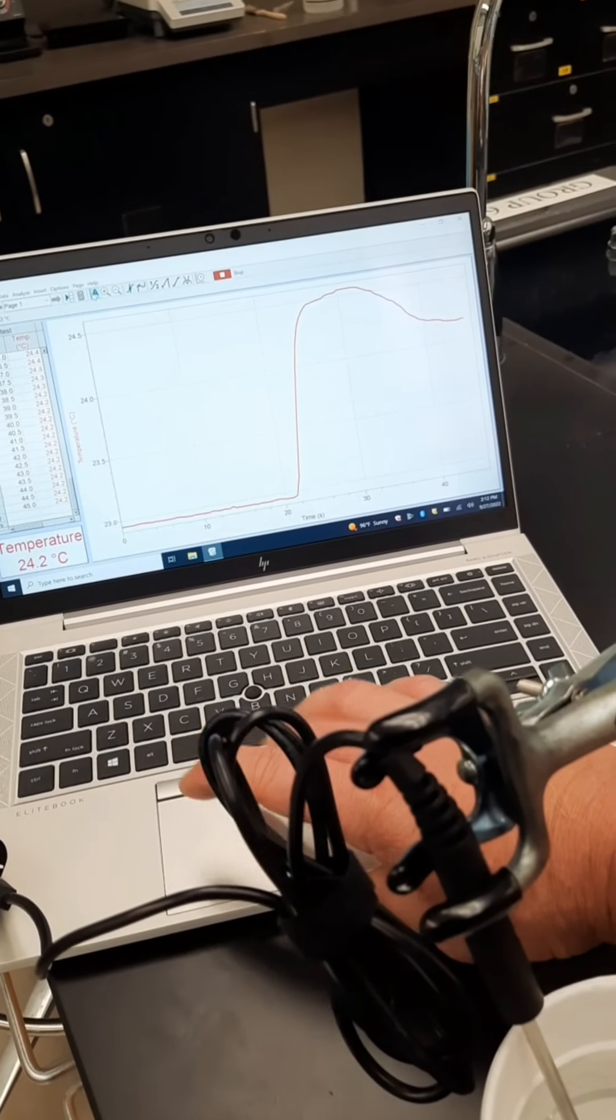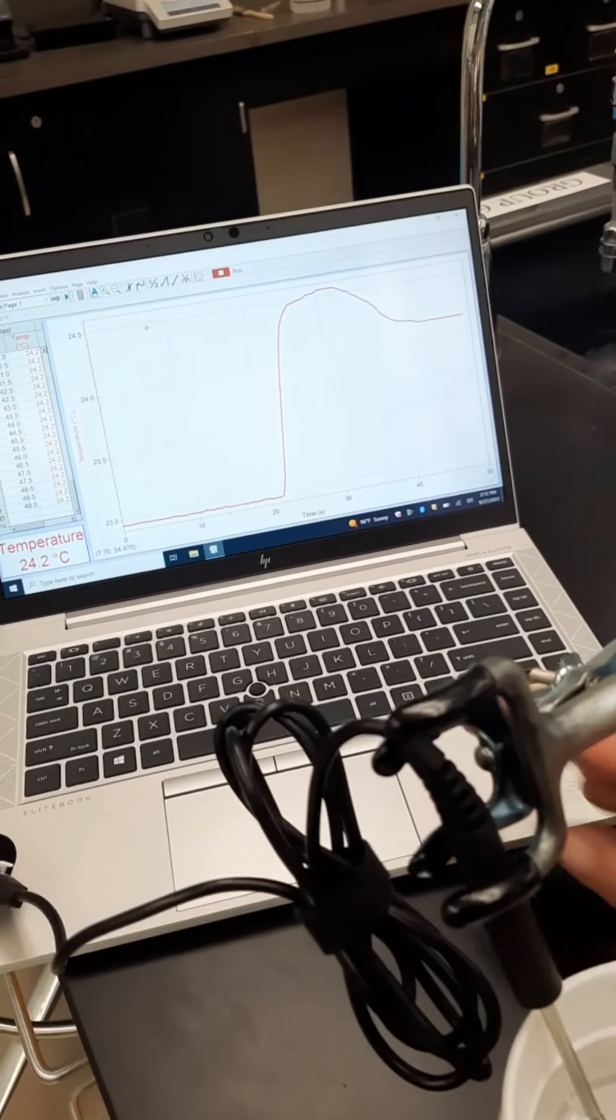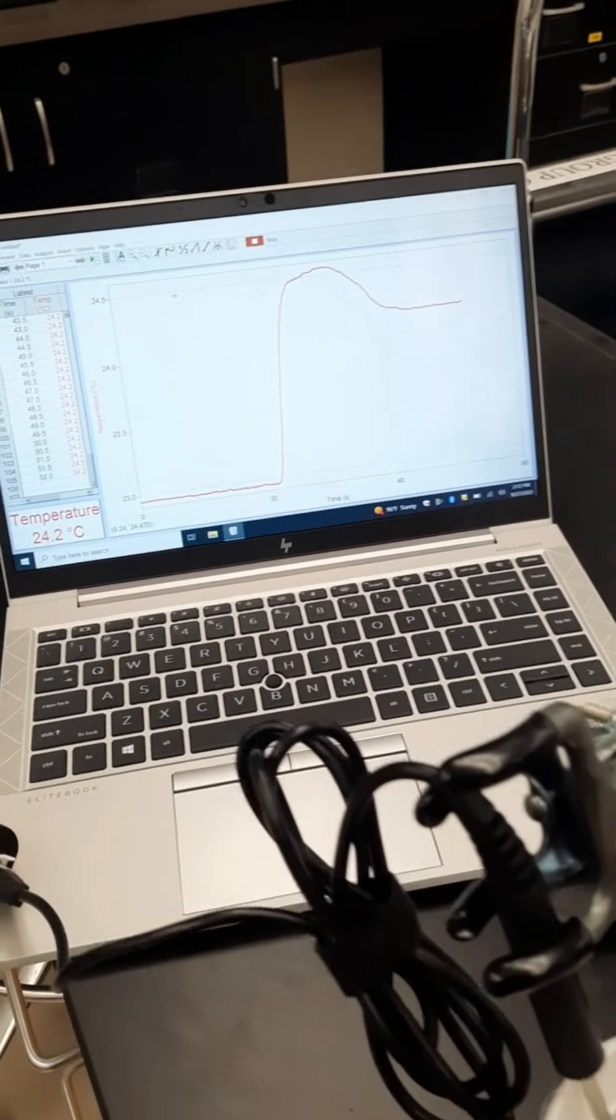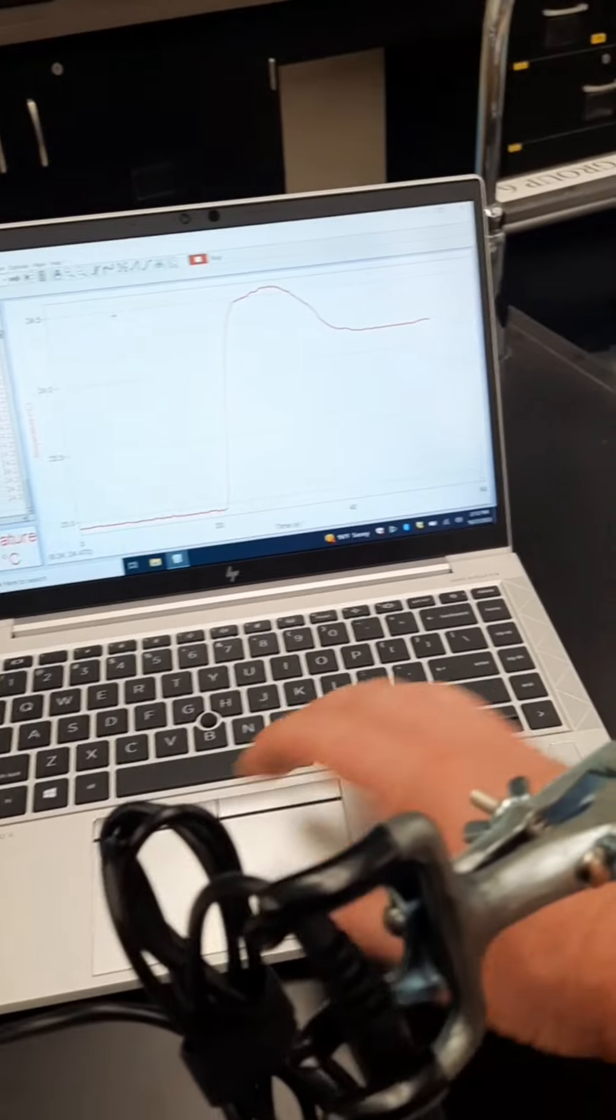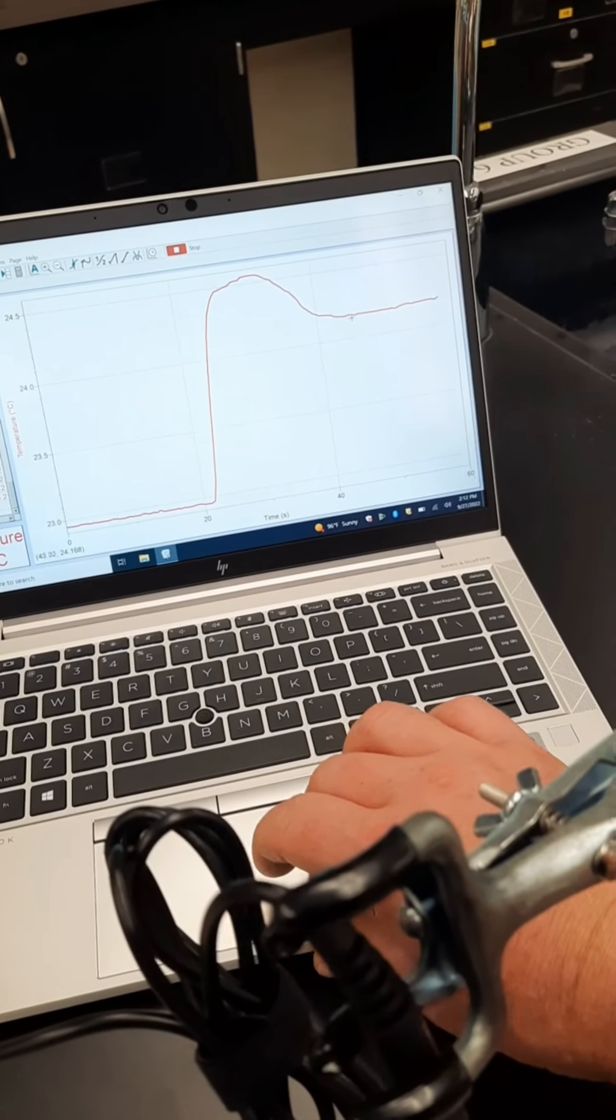Temperature is rising. Note that the experiment is over when the temperature starts going down.